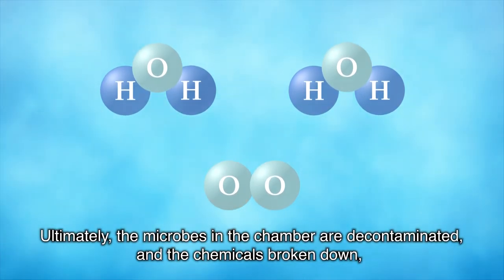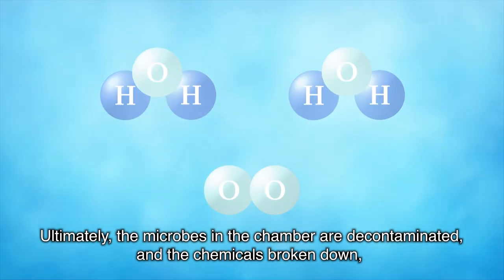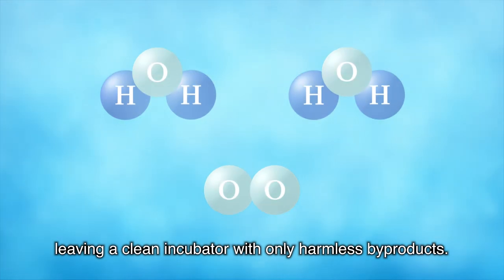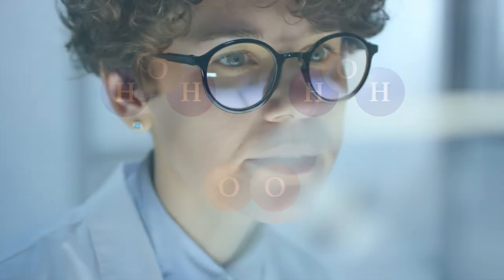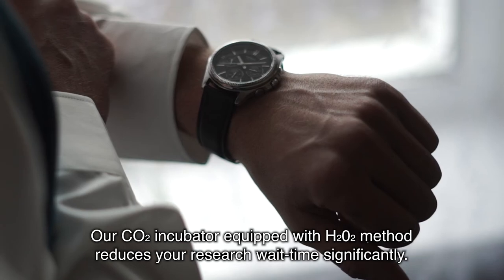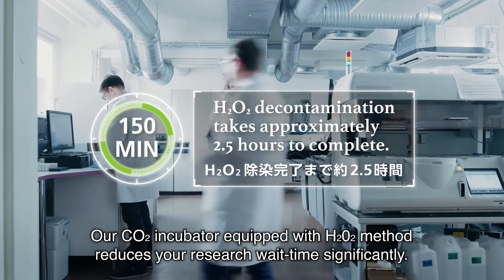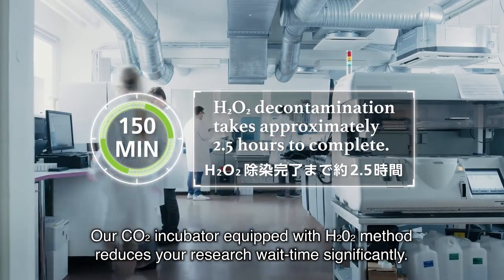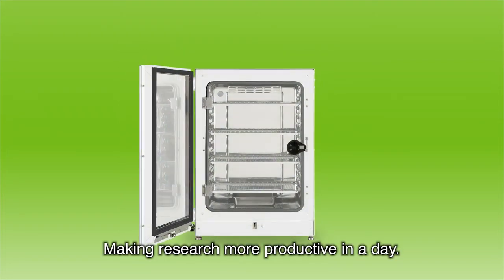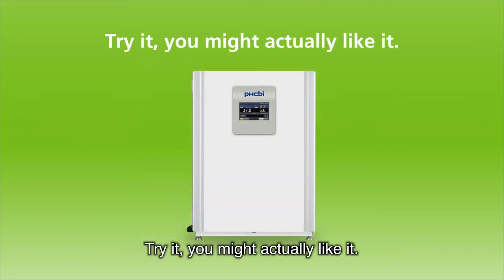Ultimately, the microbes in the chamber are decontaminated and the chemicals broken down, leaving a clean incubator with only harmless by-products. Our CO2 incubator equipped with H2O2 method reduces your research wait time significantly, making research more productive in a day. Try it, you might actually like it.